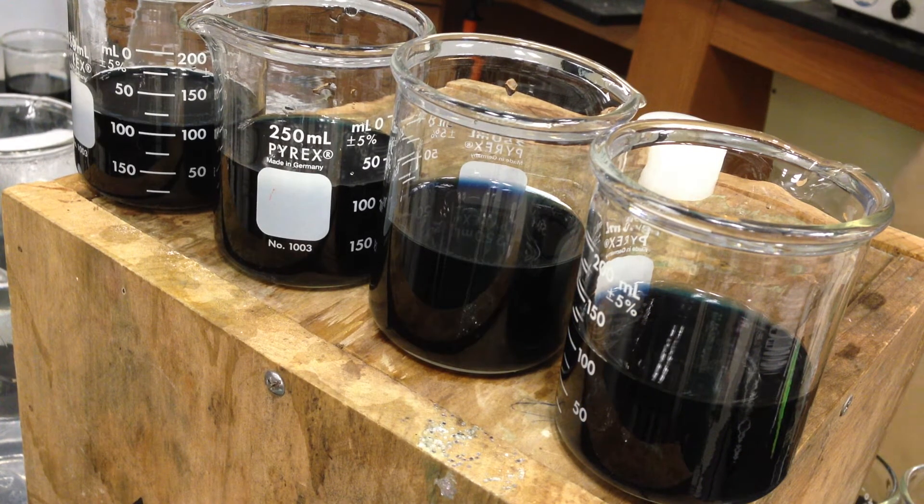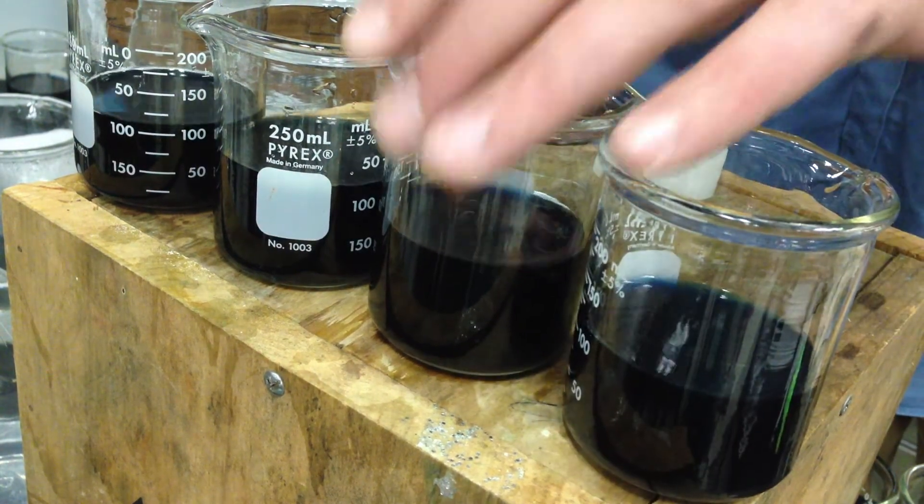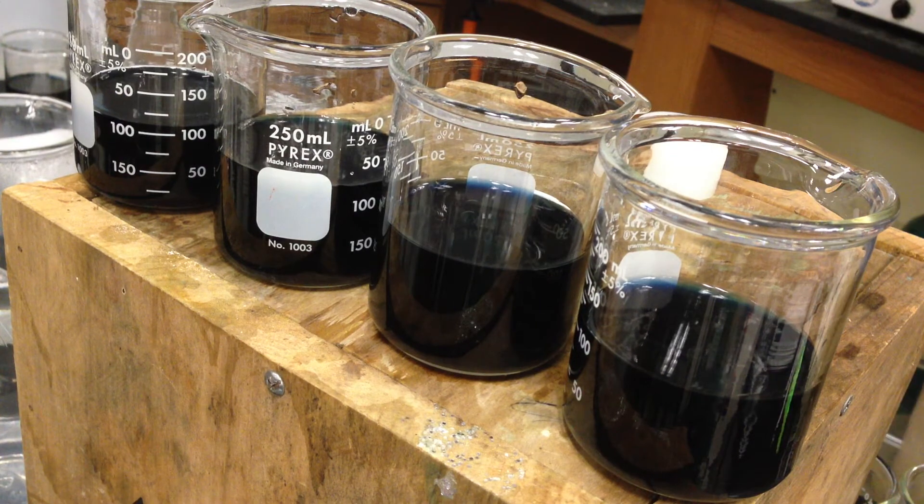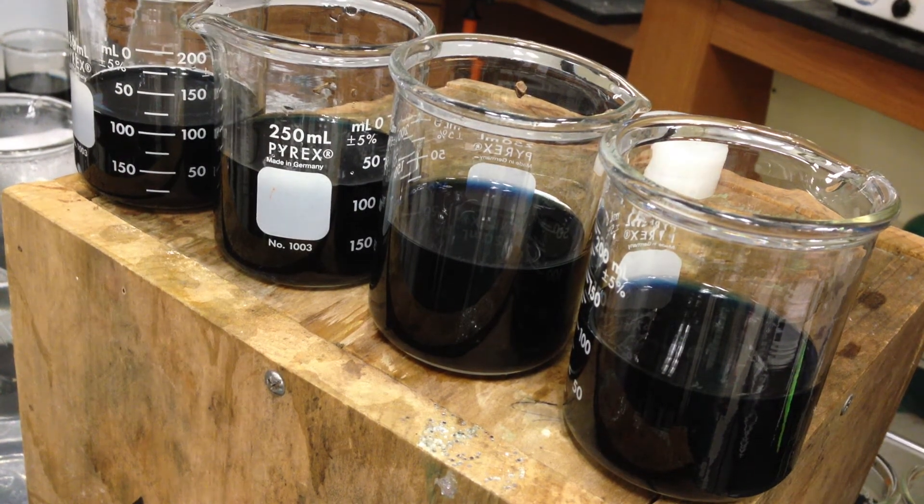That's with a total of 20. Alright, so it didn't exactly go the way I planned. And again, I was eyeballing these. So it stinks to be me. But obviously, change the concentrations, you change the rate. Okay?